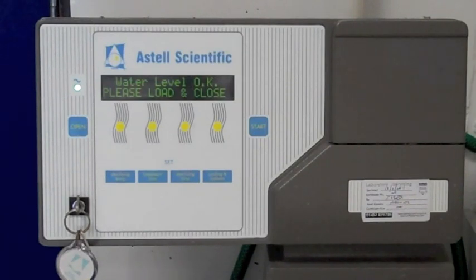Okay, this is our autoclave. As you can see, it's made by Astell Scientific. An autoclave is basically a large pressure cooker that allows you to use superheated steam to sterilize media and also inactivate a number of enzymes.